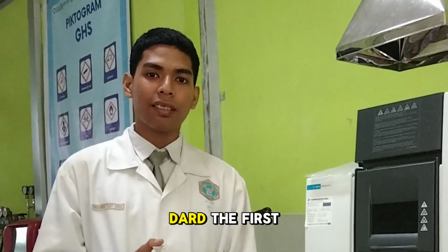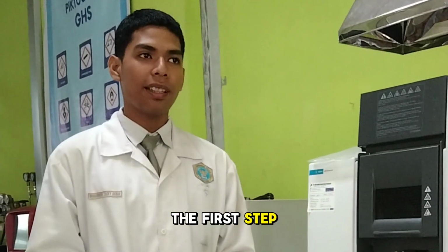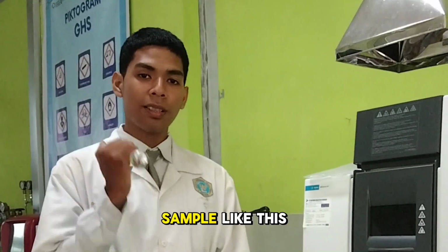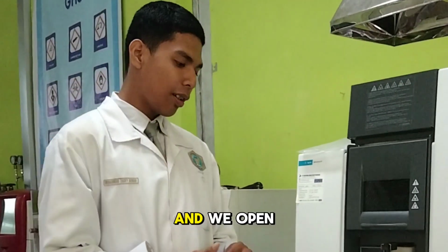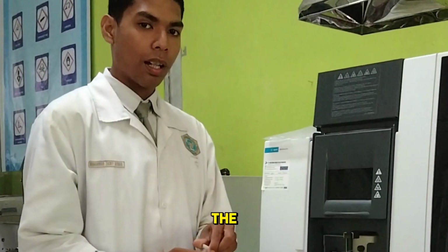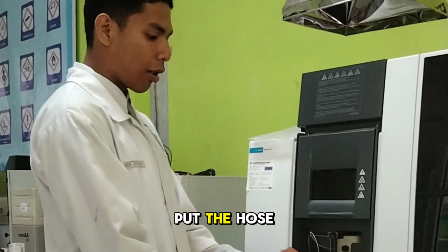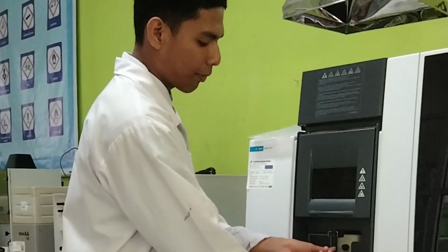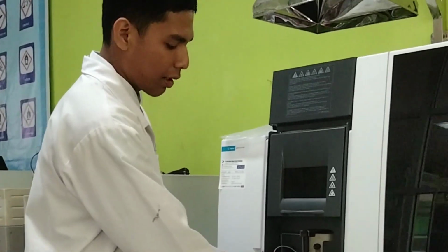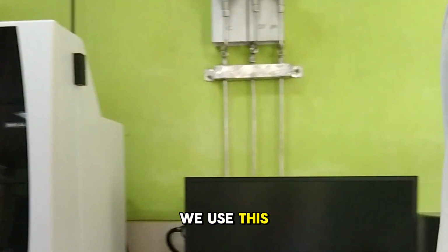This is the first standard I use with this tool. The first step is to homogenize the sample like this, then we shake it, open the cap, and put the hose into the volumetric flask. Then we use this computer.